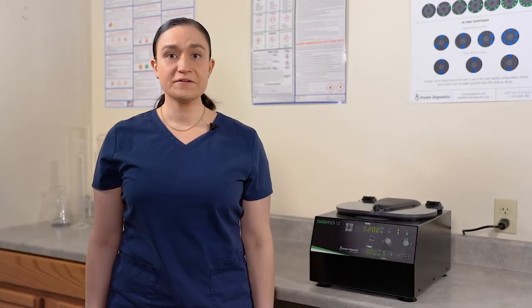Now let's look at how to load your Dash Flex 12 and spin your first samples — Part 3: Spinning Samples. When loading the Dash Flex 12, or any centrifuge, it is important to make sure you load the samples in a way that keeps the rotor balanced. Loading balanced samples helps keep the lab safe and ensures the maximum lifespan for your centrifuge.